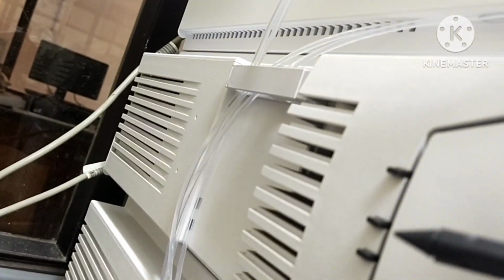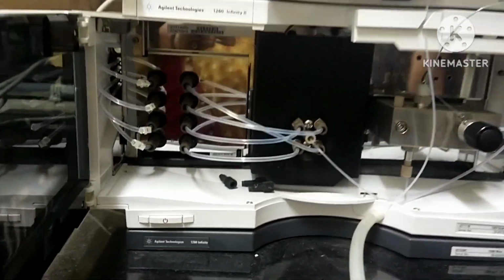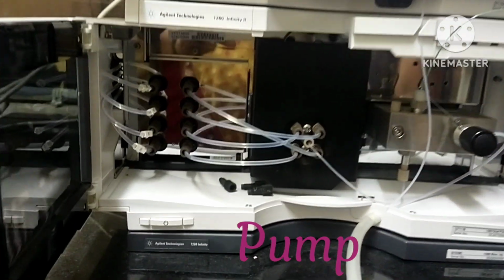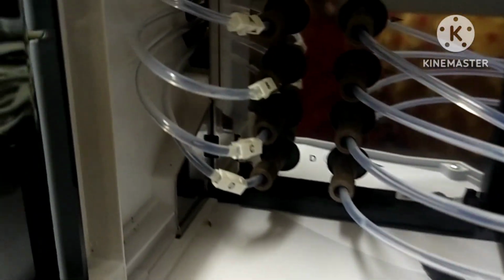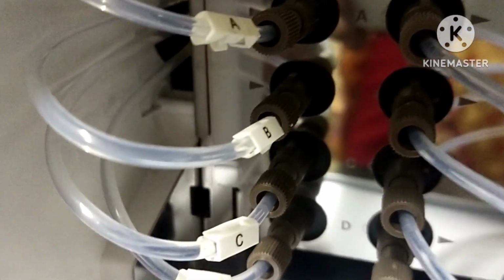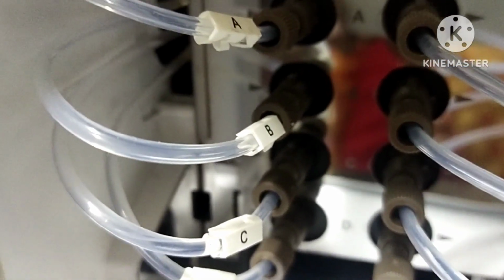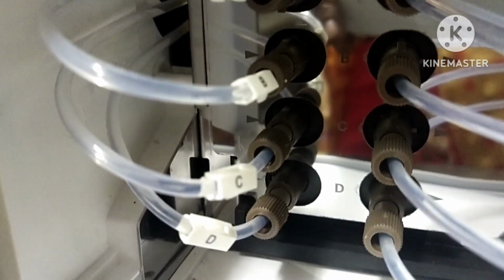In Agilent 1260, degassing of solvents is done in a built-in vacuum degasser. This is the pump. Here, a quaternary pump is used. The pump generates a flow of eluent from the solvent reservoir into the system. High pressure generation is a standard requirement of pumps. Here, the pressure range is up to 600 bar.